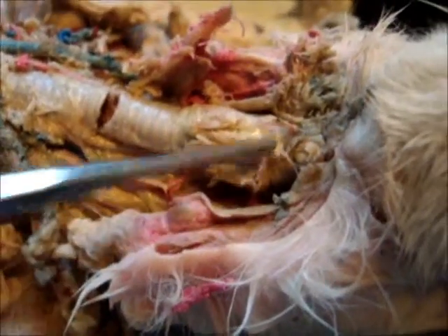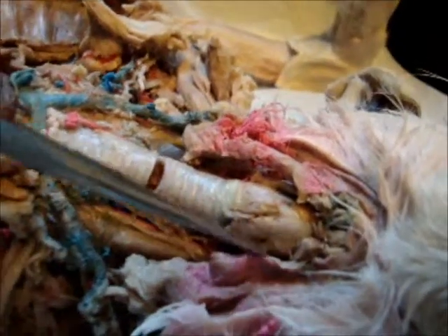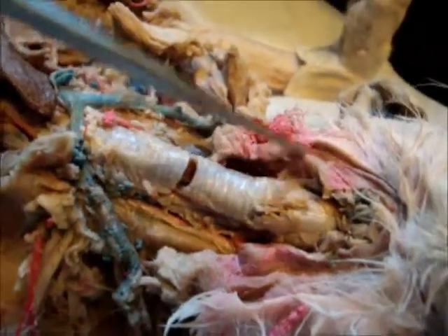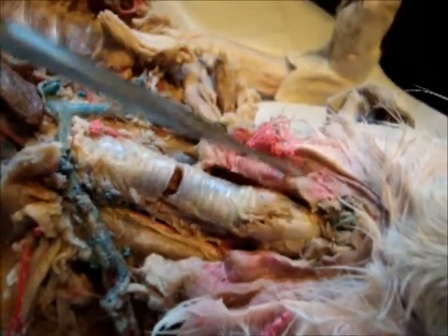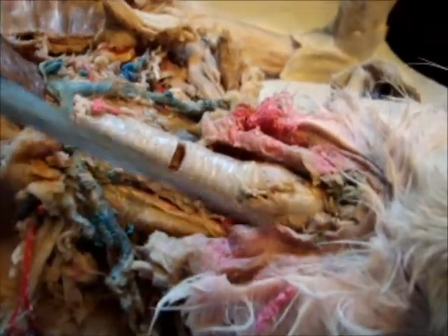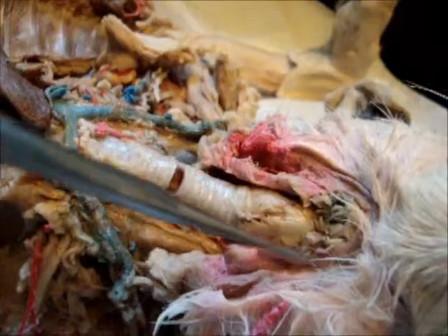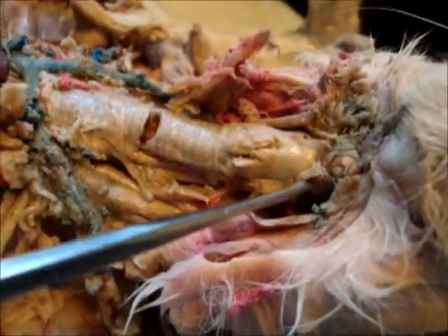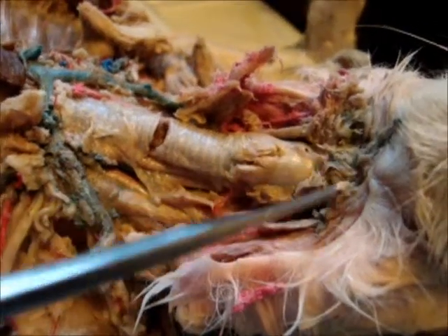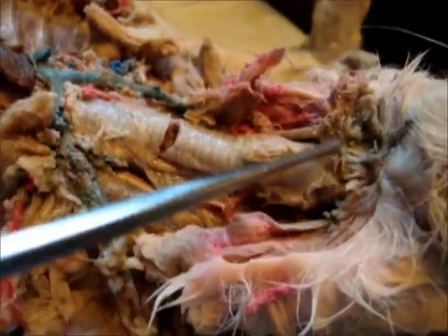Going up closer you'll see the thyroid. Right there. The thyroid gland would be located on each side. In humans, we only have just one, and it's shaped like a butterfly. But a cat, on the other hand, has one on each side, and then the thyroid cartilage. And above more would be the hyoid bone. Same structure as the human.